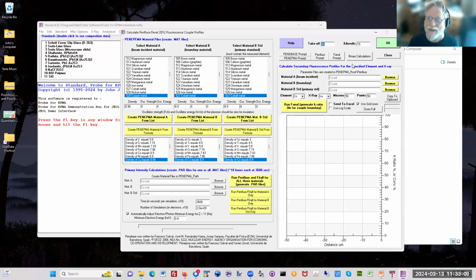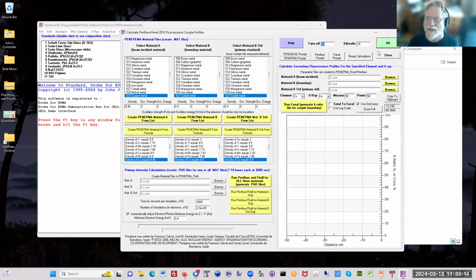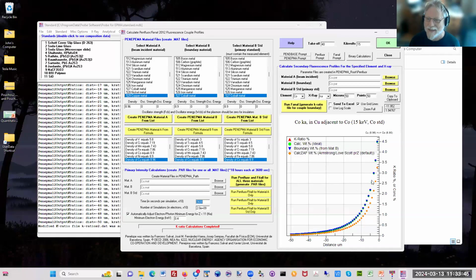A better alternative, if people want, is they can get my standard software, which comes with CalcZAF, which is free, and you can go into this window here. You saw it in the menu. You can define a beam incident material, a boundary material, and a standard for the X-ray. Castaing pointed out 80 years ago that if we put the beam into pure copper that's adjacent to cobalt, and we're measuring cobalt in pure copper, we're going to see something very strange. It's called secondary boundary fluorescence, and here it is.